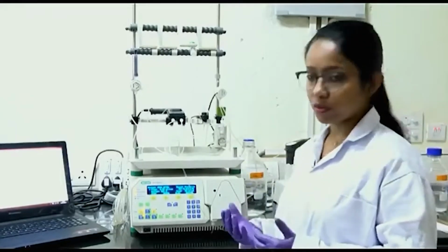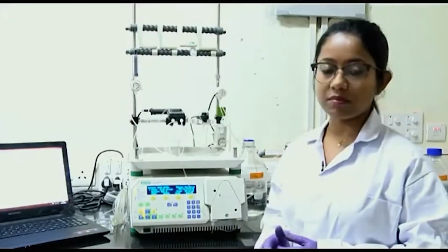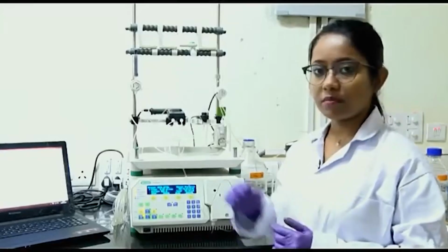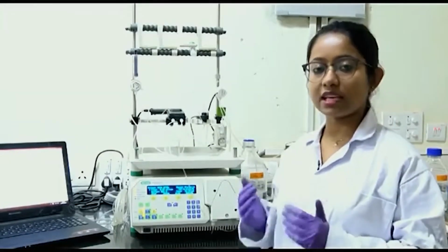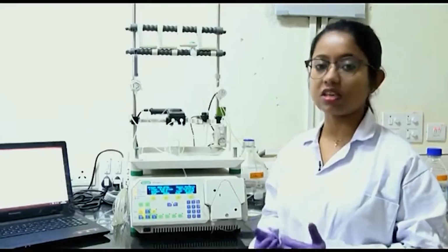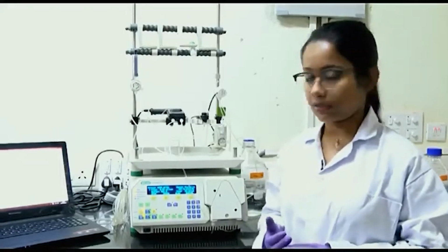Later on, as you progress, you can make the judgment whether you want to collect it or not. So, right now I am not collecting anything, but when I start the elution procedure, I will collect all the fractions. Based on the curve or the peak where I get my protein, I will select only those fractions, take a sample, and run an SDS-PAGE, that is a gel electrophoresis, to check whether my protein is present and whether any contaminant protein is present.